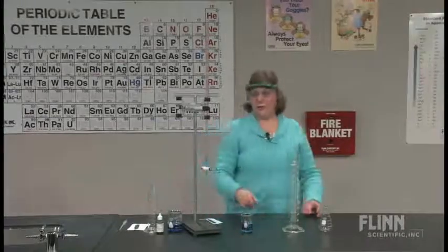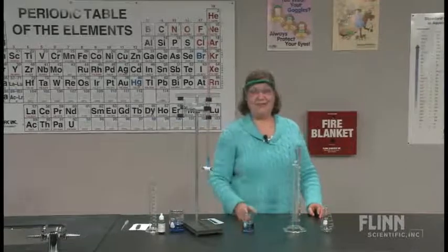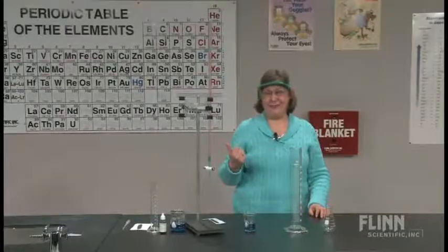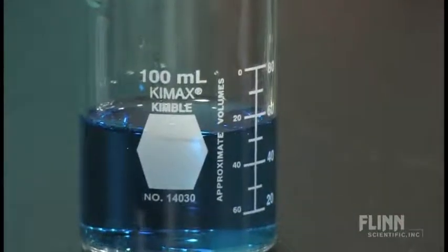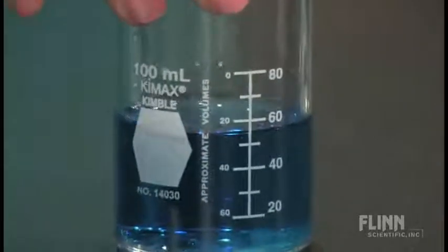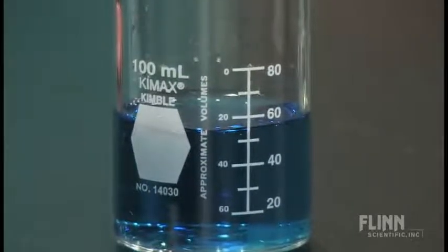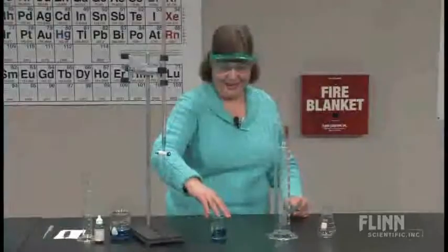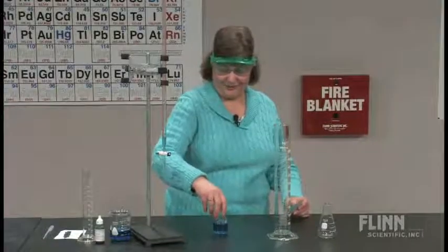And if you can focus on the volume reading in that beaker, and then I'm going to turn it around again so that I can read it, in fact, because we can't both read it at the same time here. Can you see it? You see the volume? Okay, if we've got a good shot of that, then I'm going to turn it around so that I can read what the volume is.